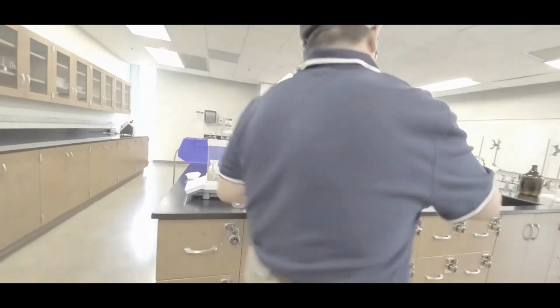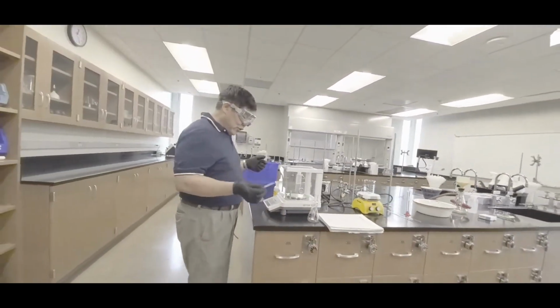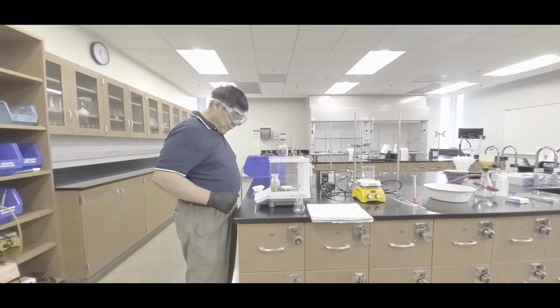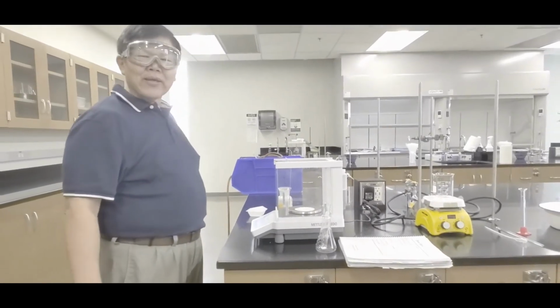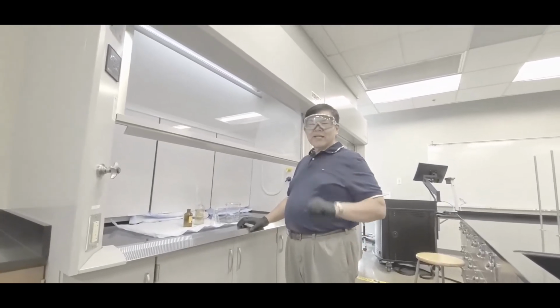So take that out, and since I'm here, what I should do is just go weigh the filter. So what you do is grab the filter. Okay, make sure you zero it again just for insurance. And then this time go this way because it's a little short thing in that case. Okay, there's your mass of the filter paper. Yeah, that's right there. In that case, all of your weighing is done for now.